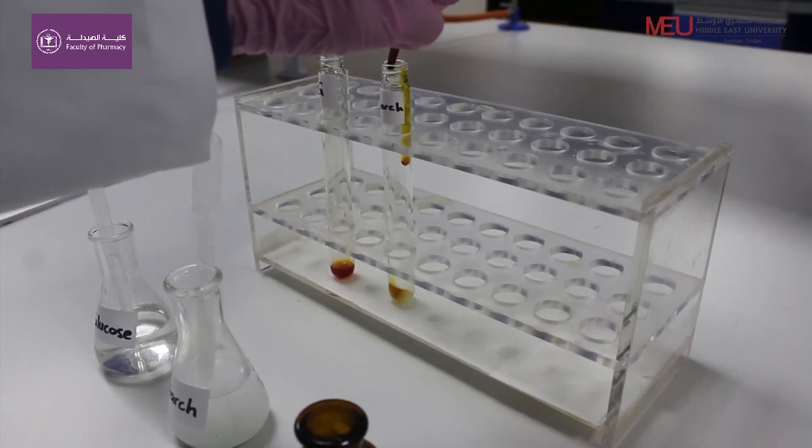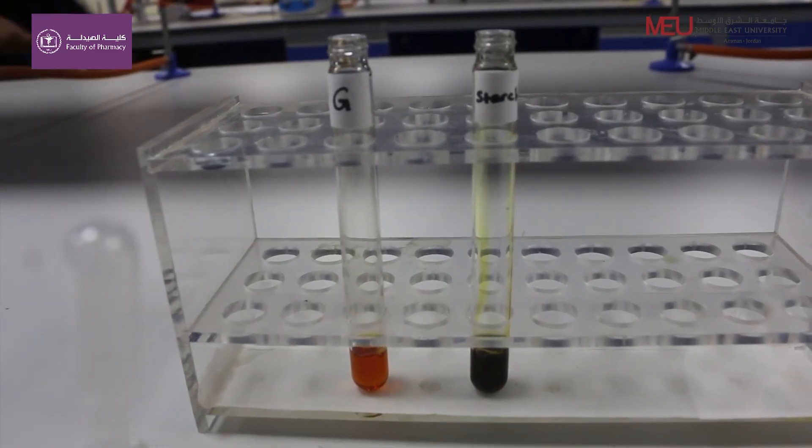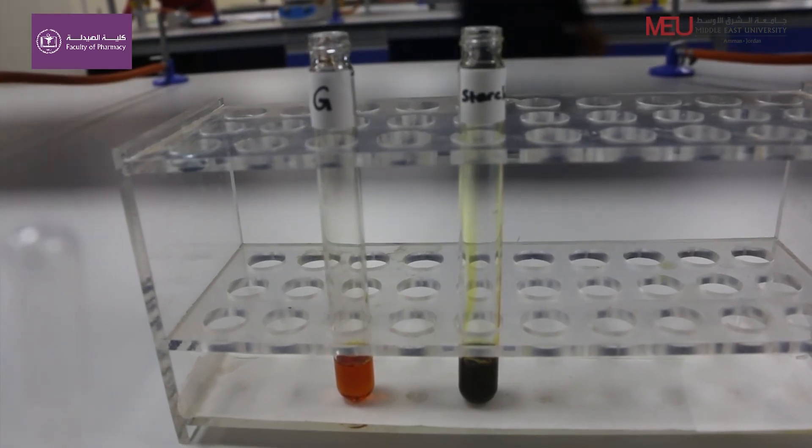You will observe positive reaction in starch solution and negative reaction in glucose solution.